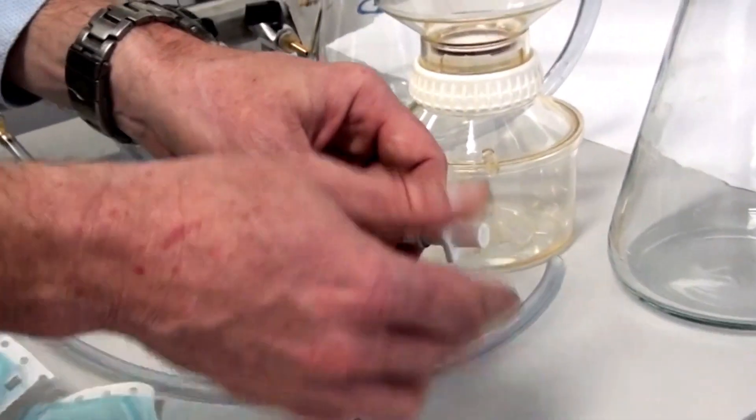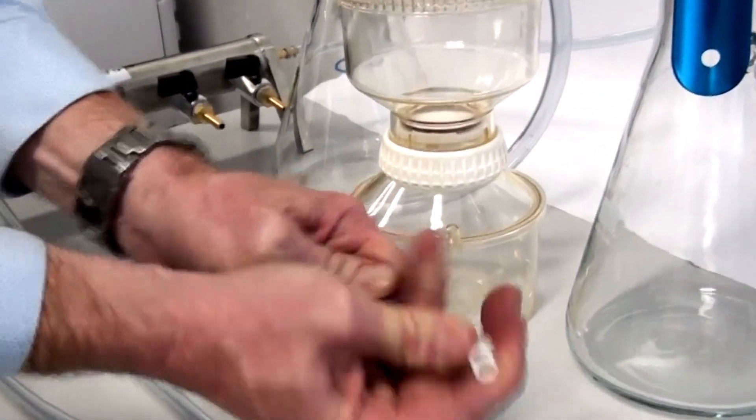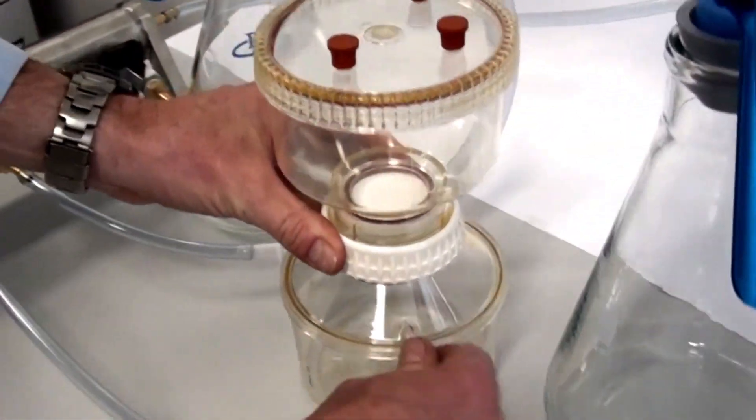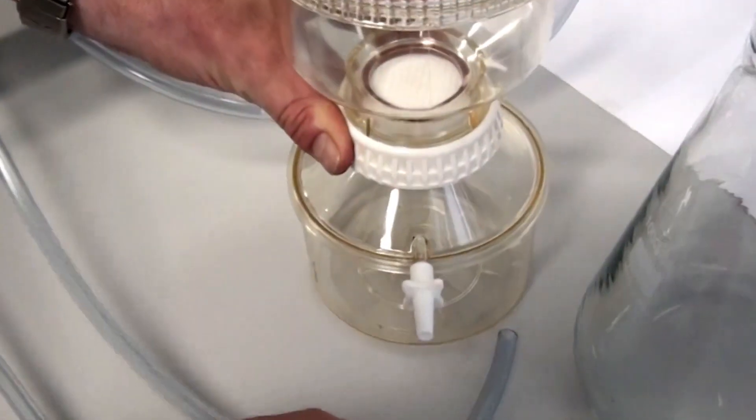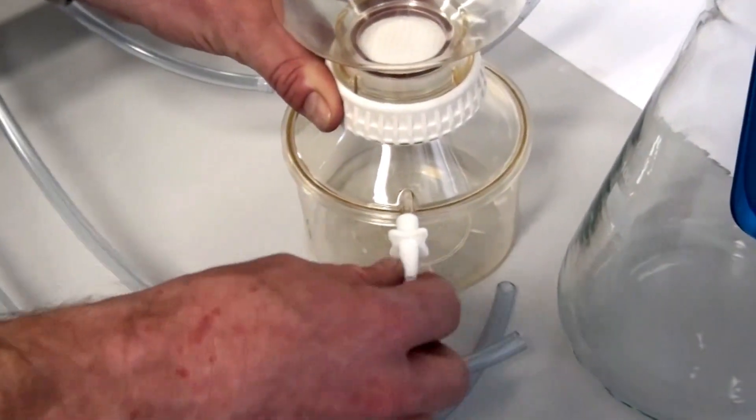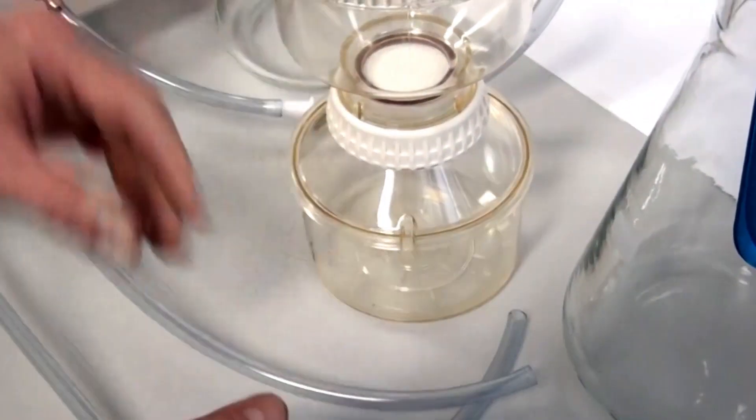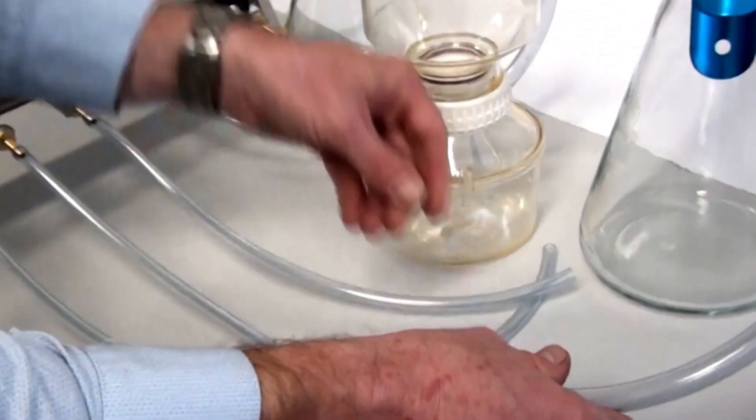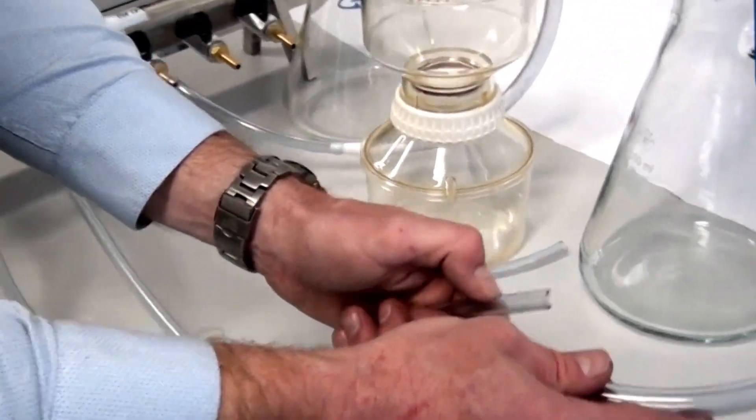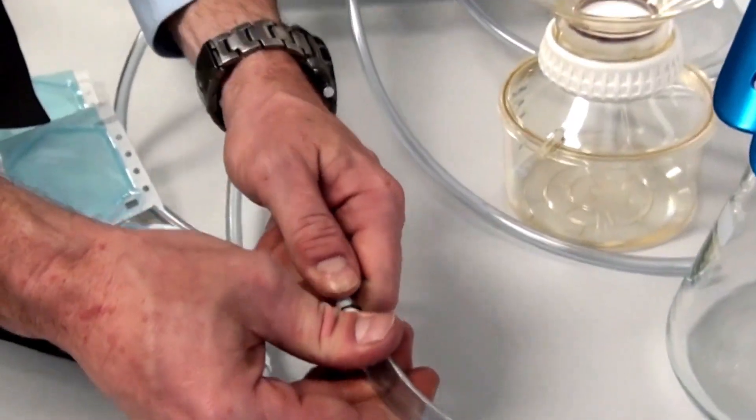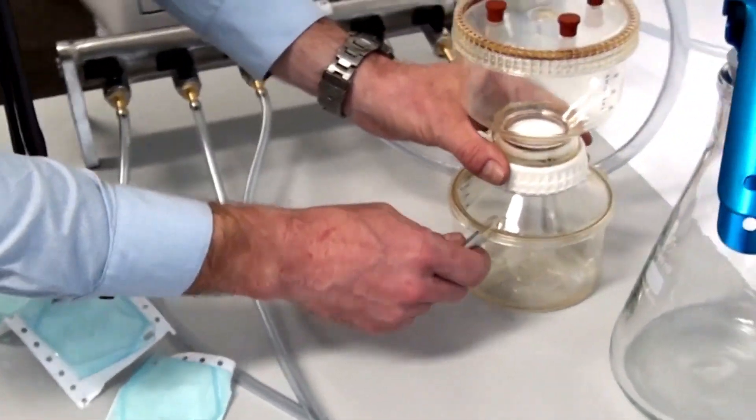And that actually just screws on, screws on here, well, pushes on there to allow different diameters of tubing. So I'll just pop him back here. There we go.